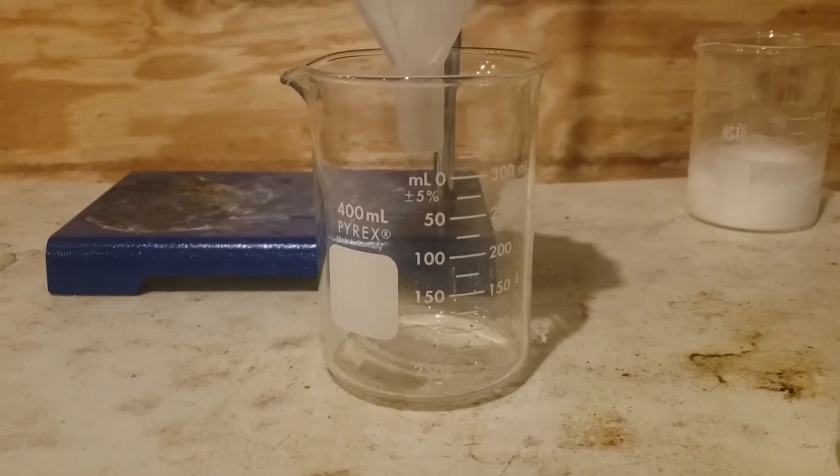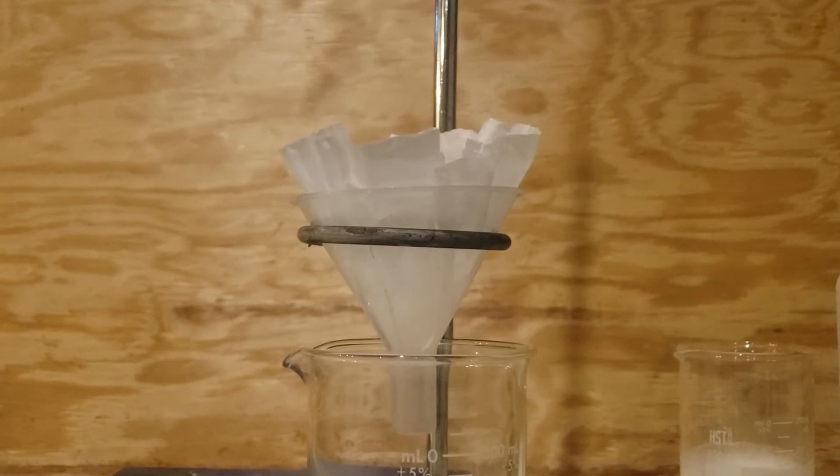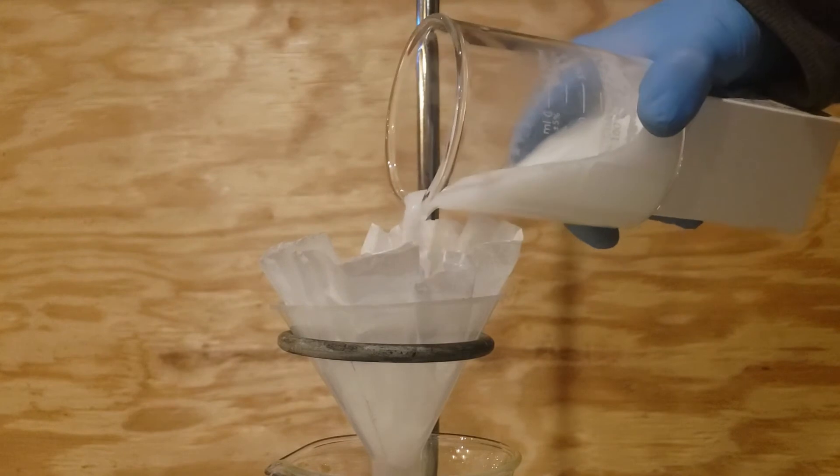Welcome back from the commercial break. After the solution has been stirring for around 5-10 minutes, I took it off the hot plate and began filtering it.